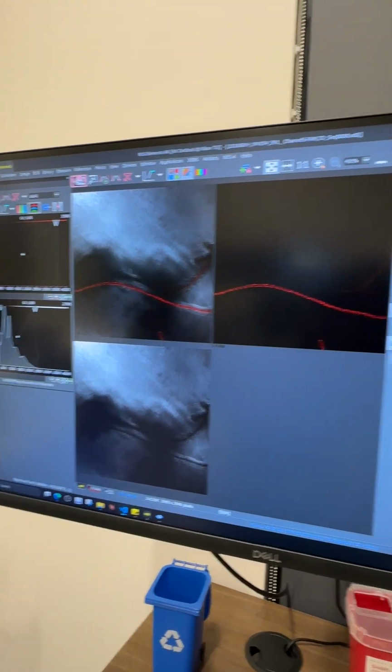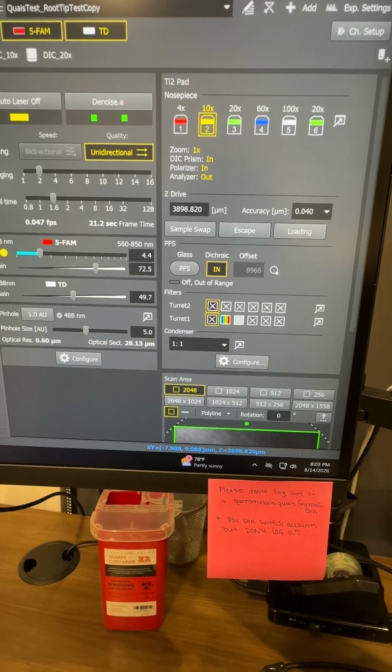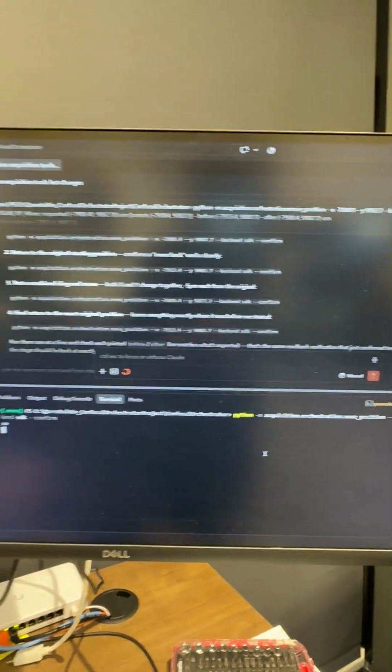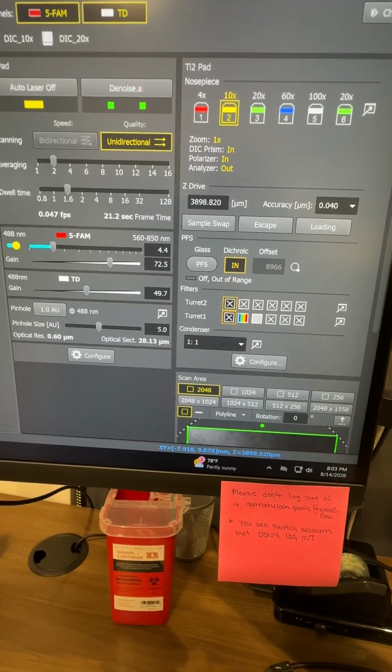Let me show you one more movement where the XY position is 7908 and 9088, and now I'm moving it to 7918 and the Y to 9077. Let's move the XY both and see how it works. So if you see here now 7918, and you can see that in the UI as well it changed.